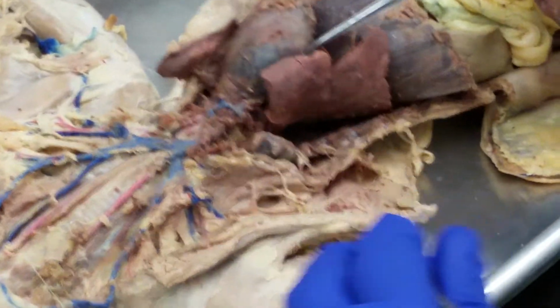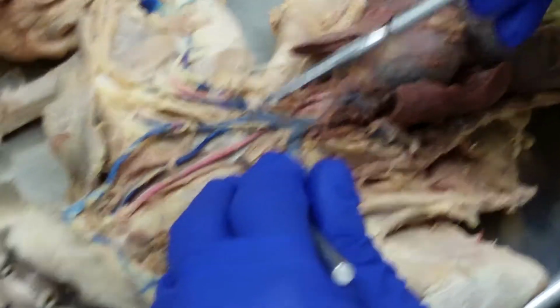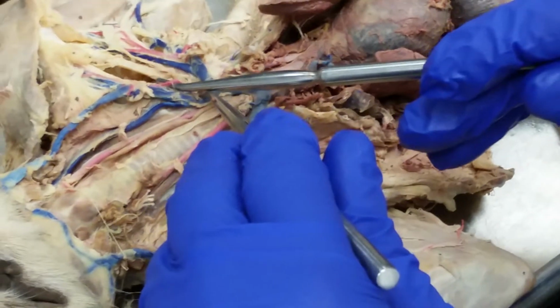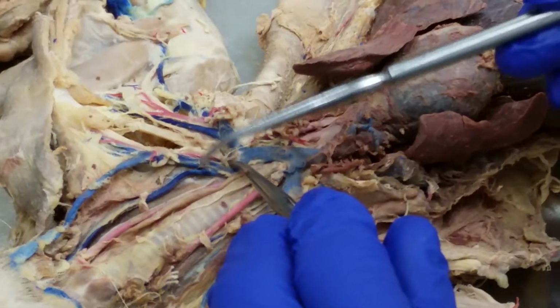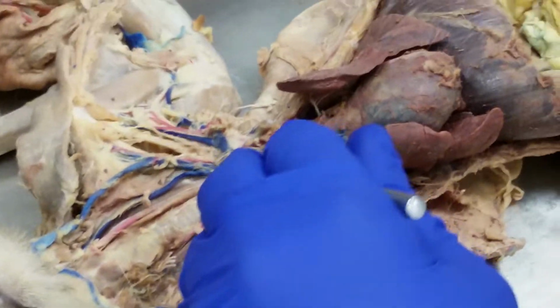All right, and so I think we got everything here. I think we need one more. This is the thyrocervical artery, is one that splits into the transverse scapular artery over here that goes to the trapezius, and then of course the transverse scapular vein from the external jugular vein. Excellent.